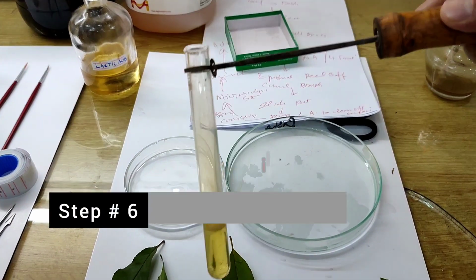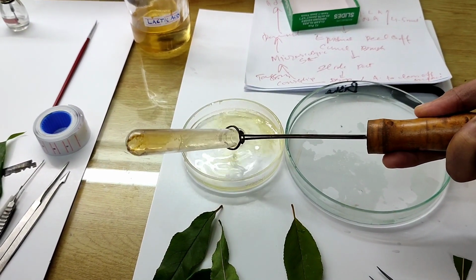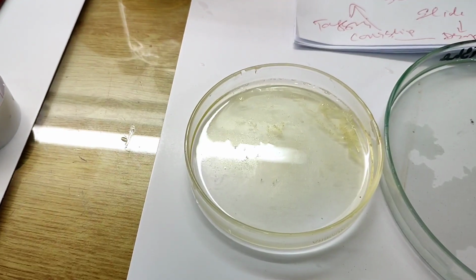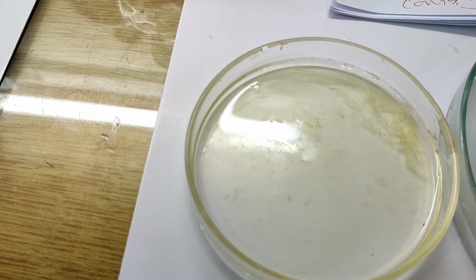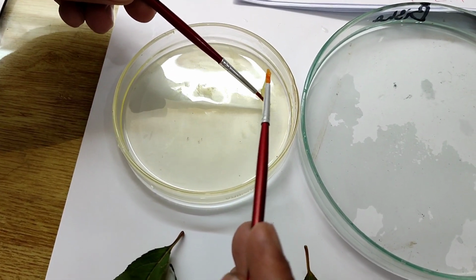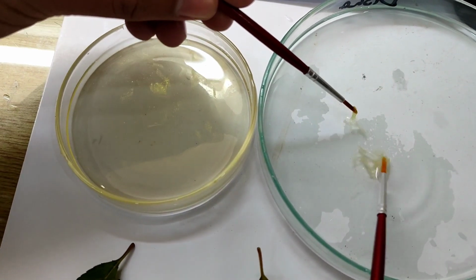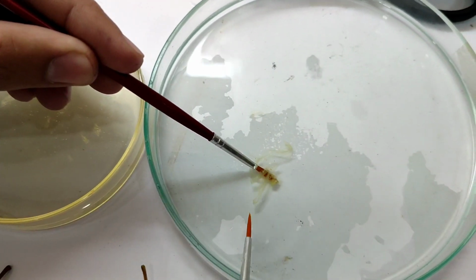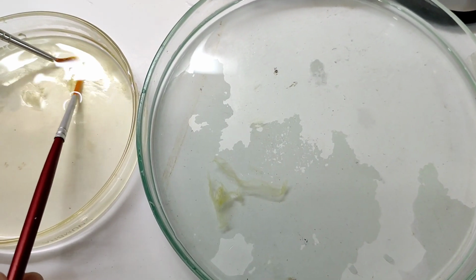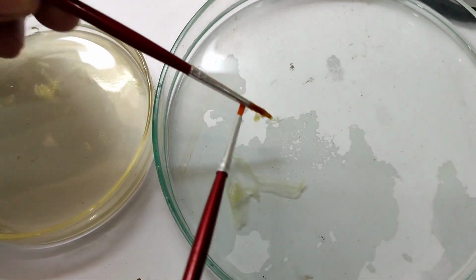Here you see the boiled leaf epidermal pieces are put into a petri dish with distilled water. This distilled water makes the small pieces neat and clean. Here you see the peels are separated from the lactic acid solution and put into distilled water to make these peels neat and clean for further use in slide preparation.